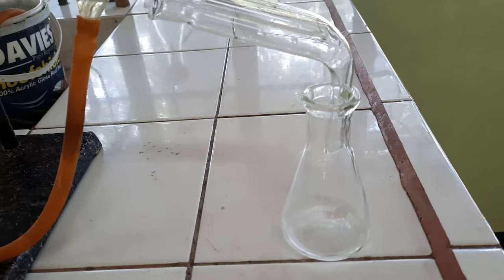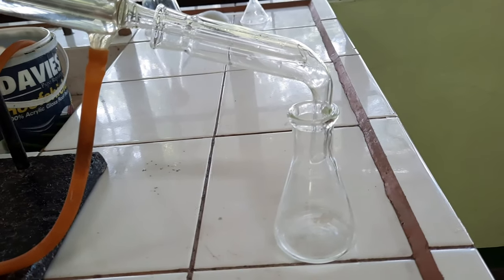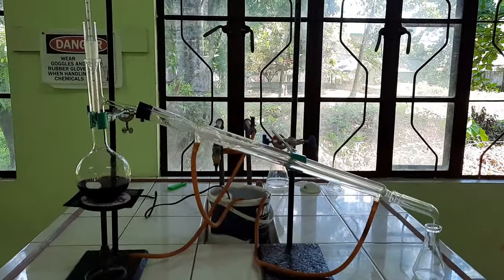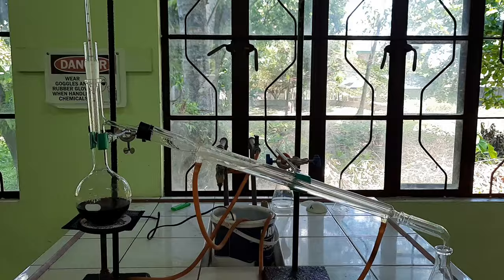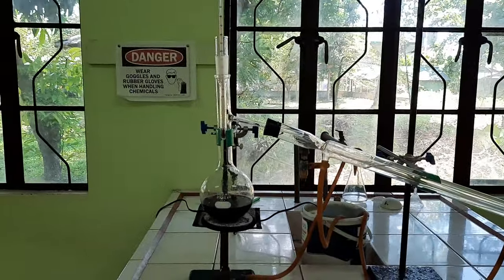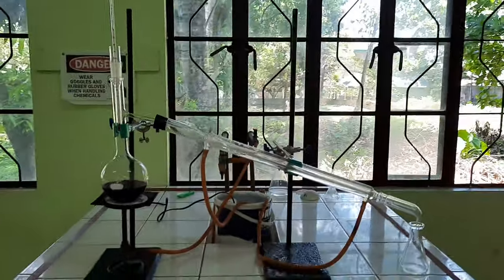Most likely this distillate contains a considerable amount of ethanol, which we will check on later. As I've said, simple distillation like this can be a way of separating miscible liquids — alcohol being miscible with water, along with some other pigments in this wine and other organic substances, can be separated using this distillation setup.